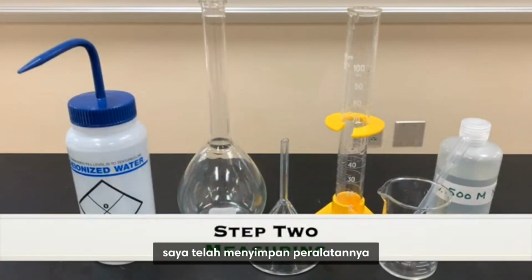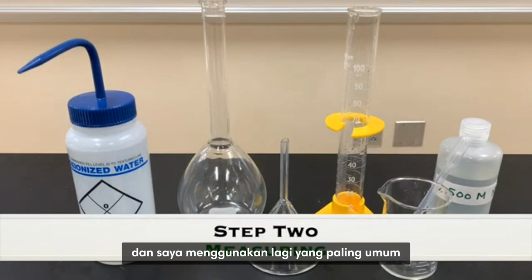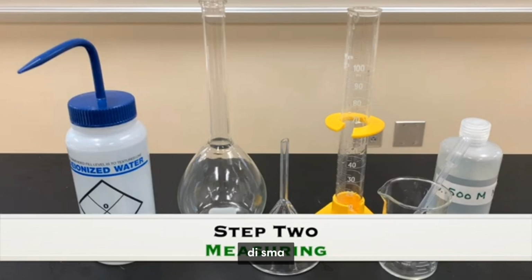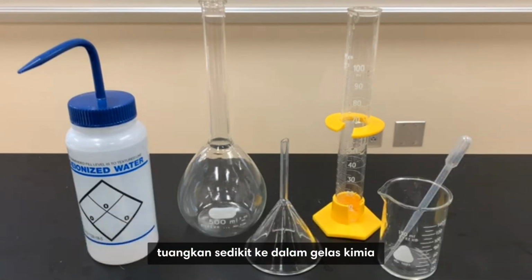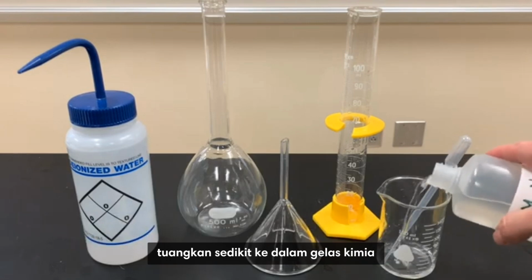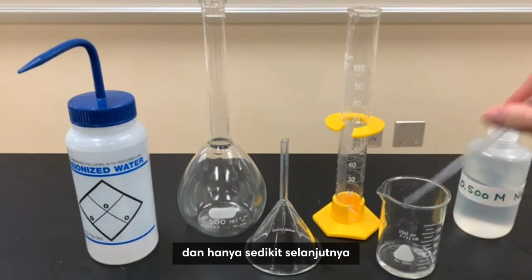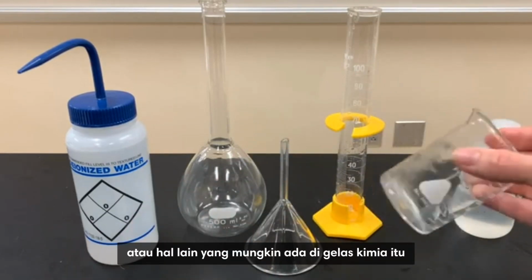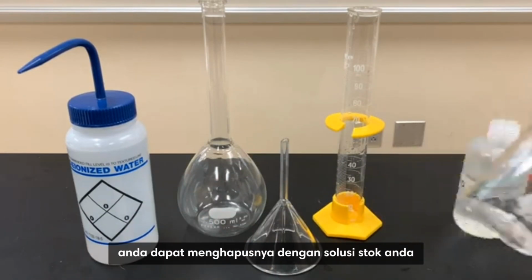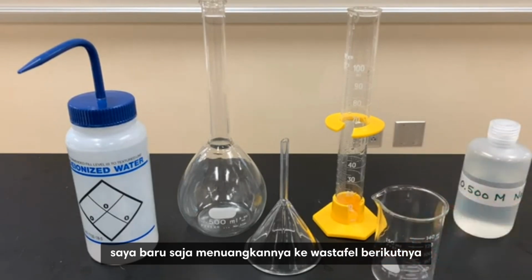I have kept the equipment I plan to use to make my solution by dilution, and I'm using, again, the most common equipment that you'd have in a chemistry lab in high school. First thing is to take your stock solution, pour a small amount into the beaker that you're going to pour more into in just a little bit. Next, swirl it around so that any water or any other things that might be in that beaker, you can remove them with your stock solution. If it's a safe solution like I have, I just poured that into the sink.